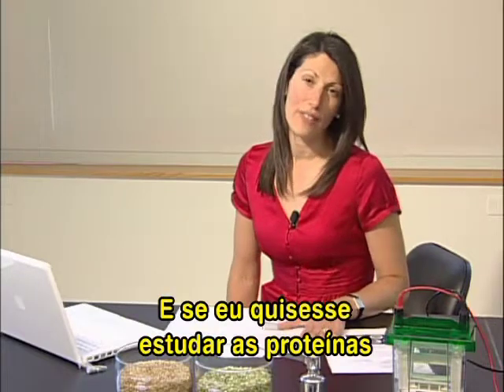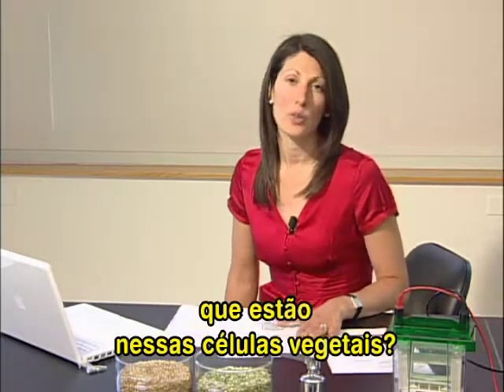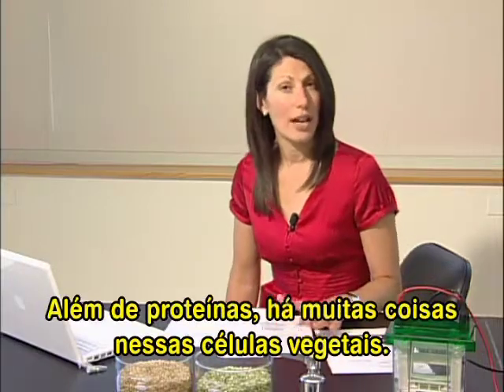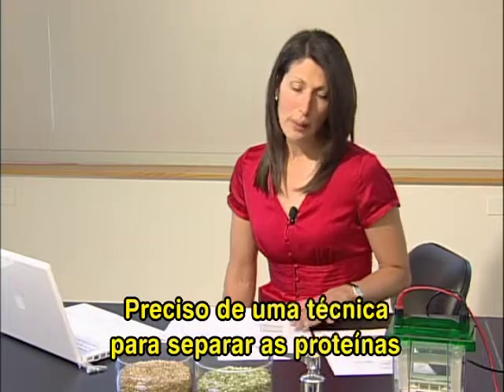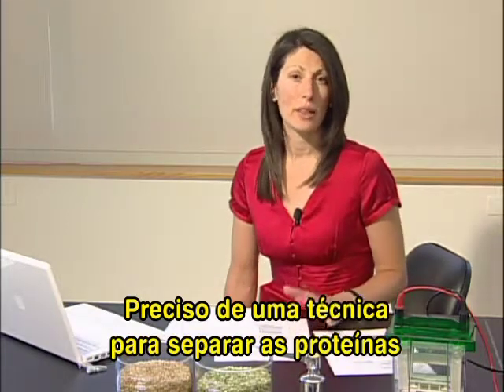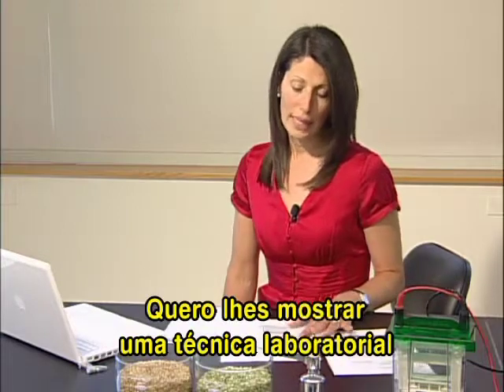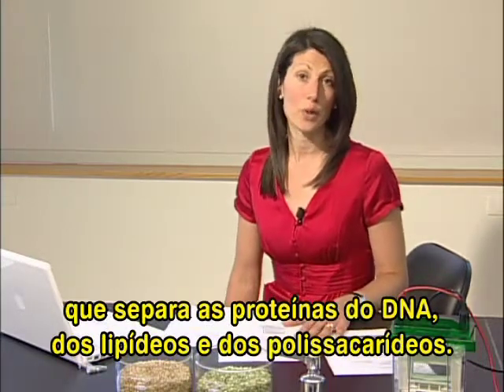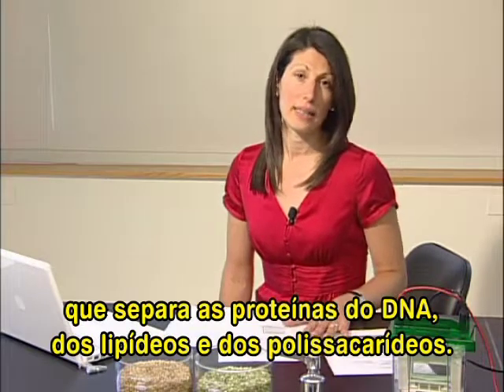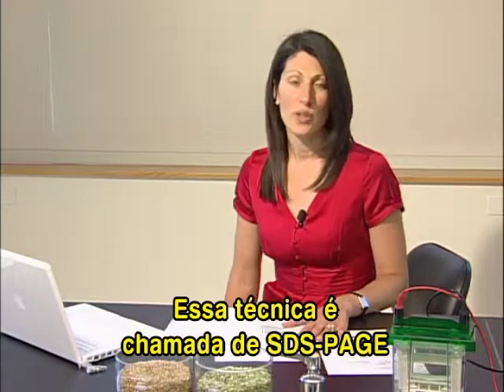So what if, in fact, what I wanted to do was study the proteins that are in those plant cells? There are not just proteins in those plant cells, but many other things. So I will need a technique to separate the proteins from the other components of the cell. And what I'd like to do next is show you a laboratory technique that separates proteins from DNA, lipids, and polysaccharides. And that technique is called SDS-PAGE.